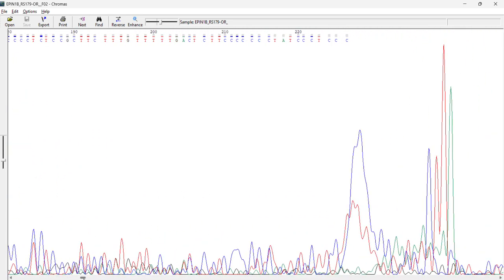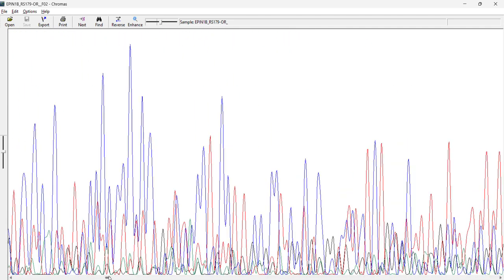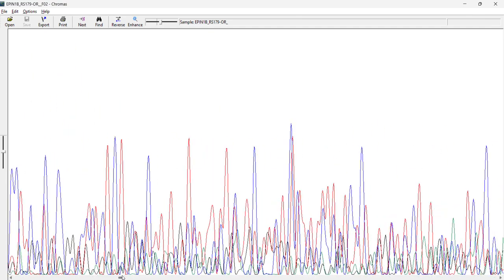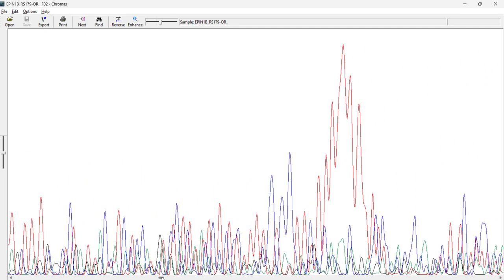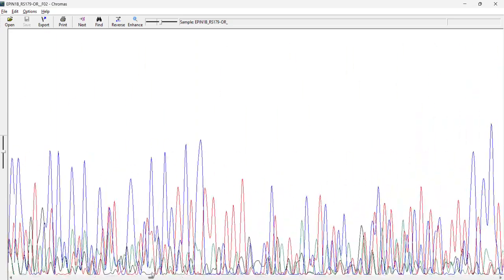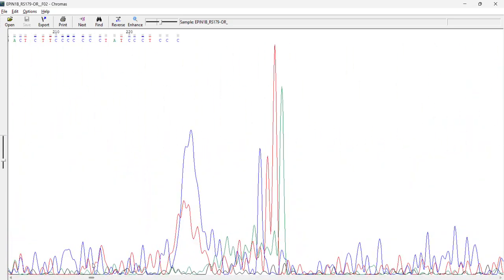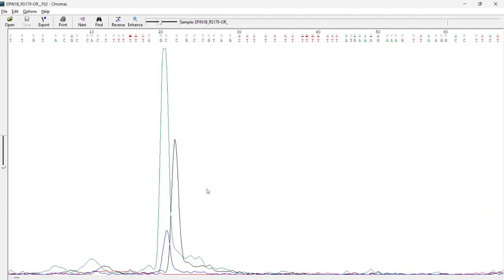So this is the sequence, and it is quite disturbing. So this will be generally rejected, and this won't be considered as a good Sanger sequencing result, right? So I think it has already ended here. Yeah. So after this, all it has read is just the dye that is giving its traces, right?